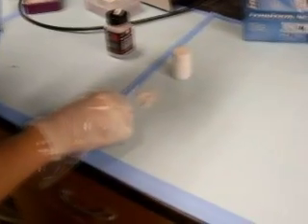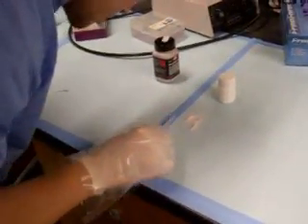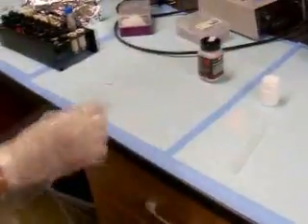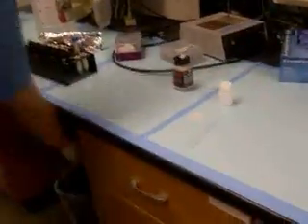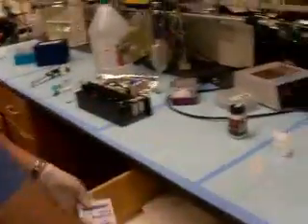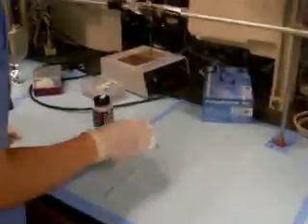I don't see how this can work very well without using a real brush. Maybe if we scoop it onto a Kim wipe? Or what if we scoop it onto a piece of wax paper and then tilt the wax paper into... You mean just move this? Yeah. But how does that actually rub the two surfaces in contact? Right, we'll just have to wipe up the excess with a Kim wipe and then try to shove it into that bottle, like waste bottle or whatever.